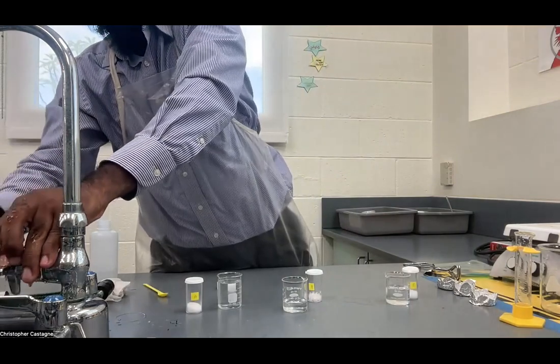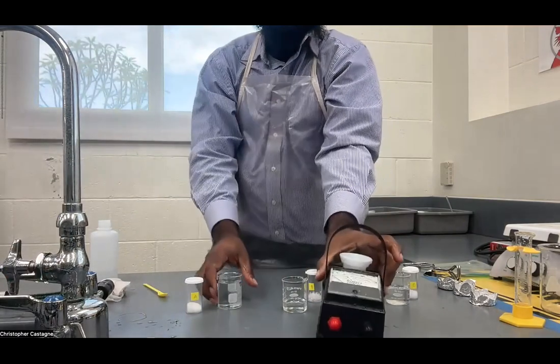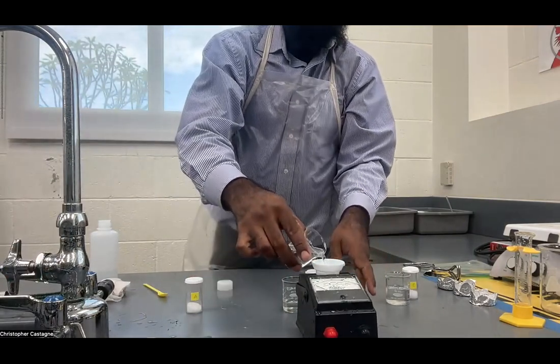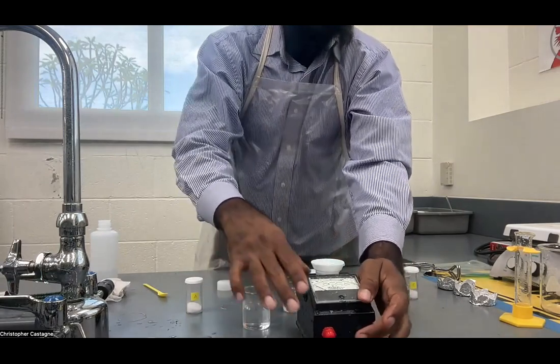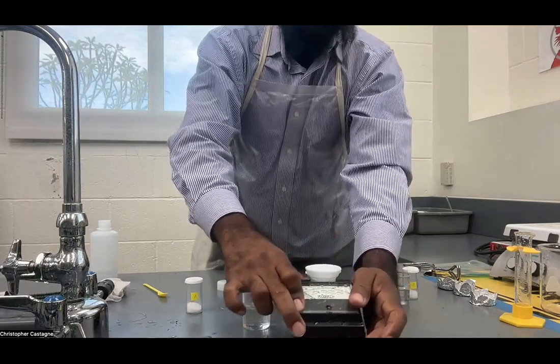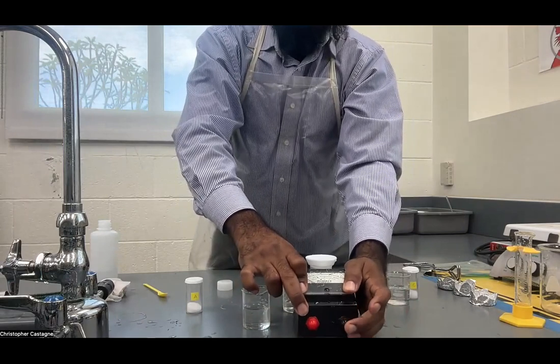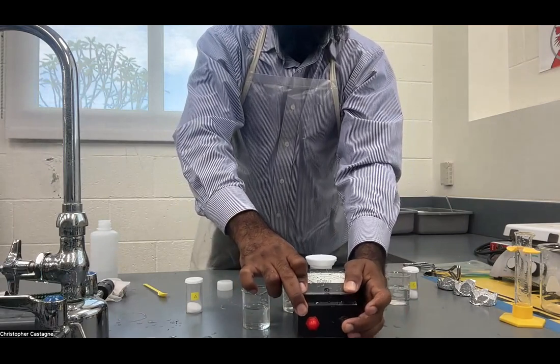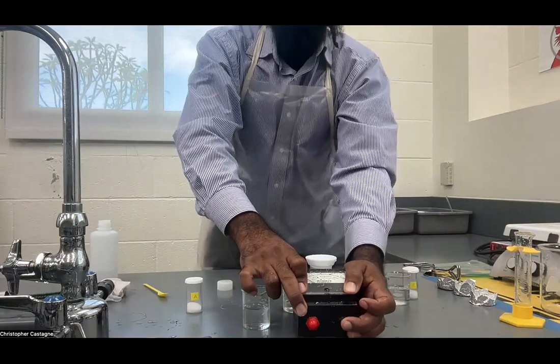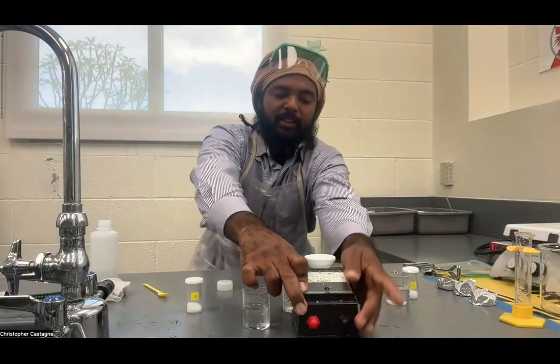We test the meter in between. Now we'll test substance A. It's working, but does it conduct? Again, just the slightest deflection — but practically zero. So we'll just call it zero, and that's the end of the conductivity test.